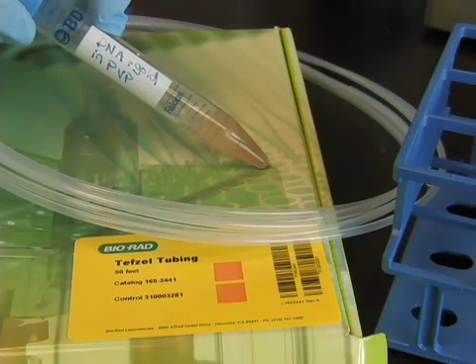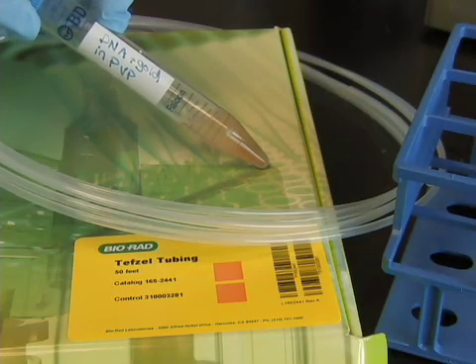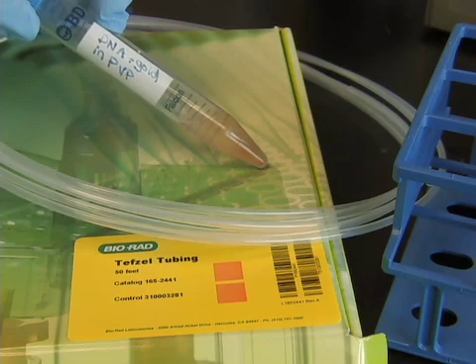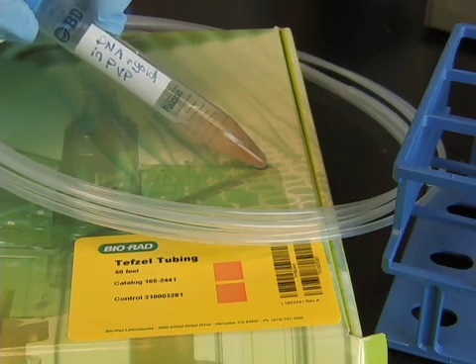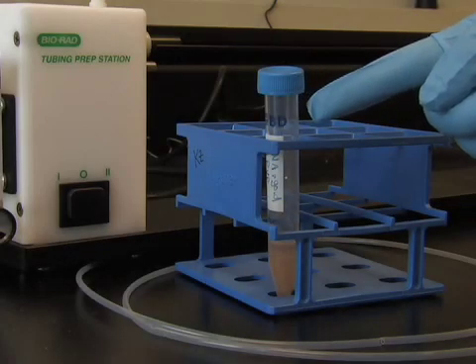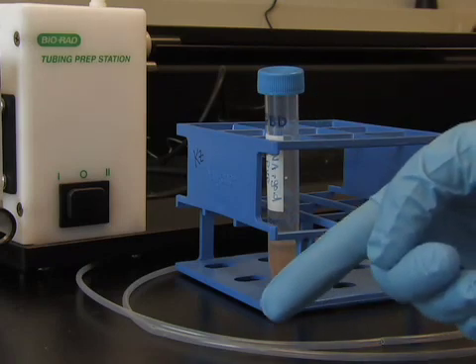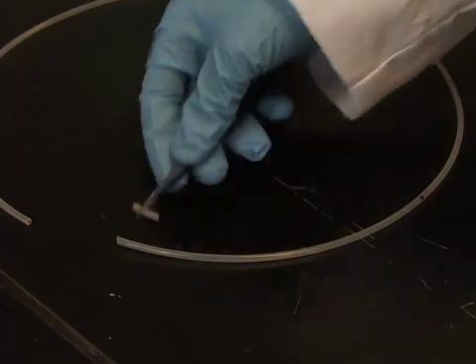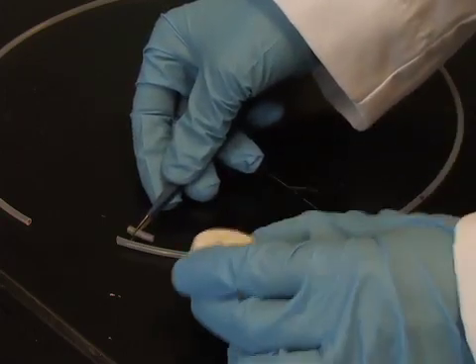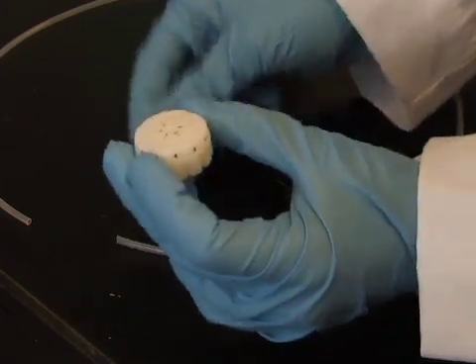Now we're ready to coat the plastic tubing that will be used to house the gene gun bullets when they are loaded into the gene gun. Now that the gold is coated with DNA, we need to line the inside of the plastic tubing with the gold particles. This gold coated plastic tubing is what will actually be loaded into the gene gun.